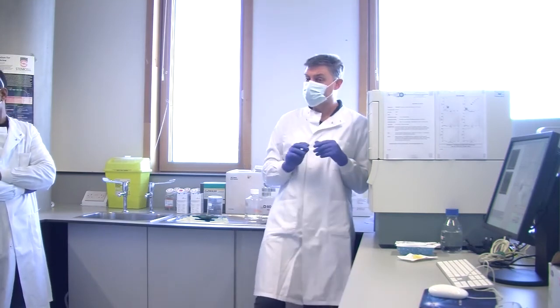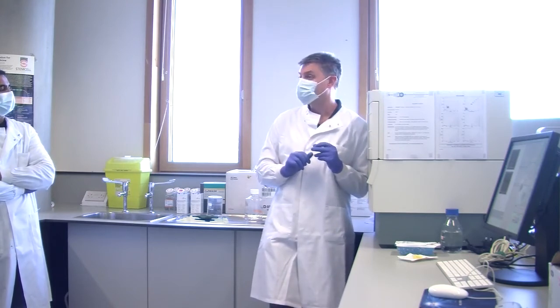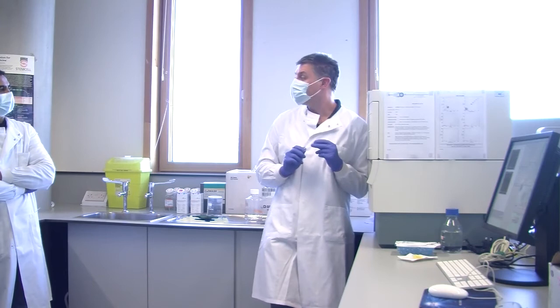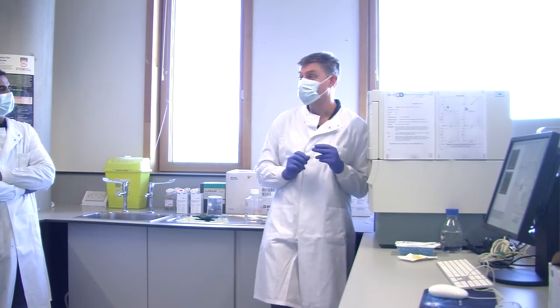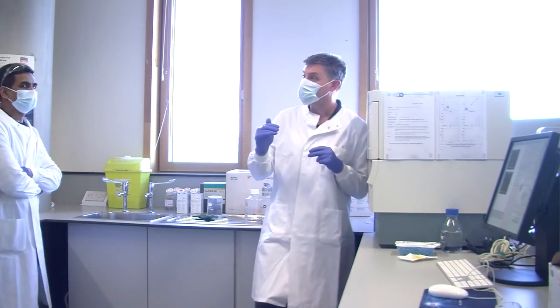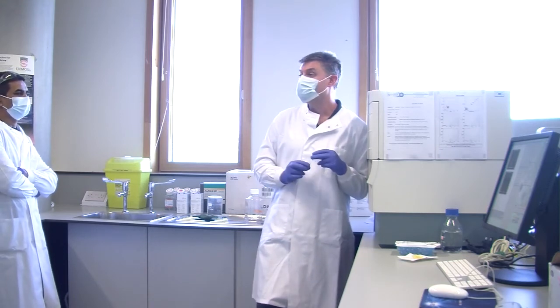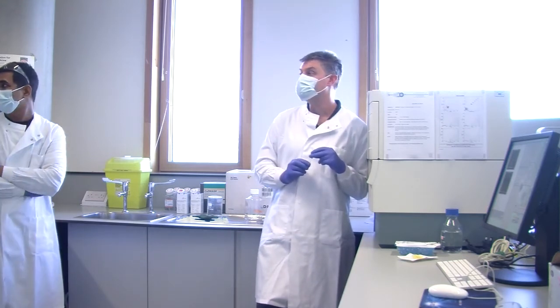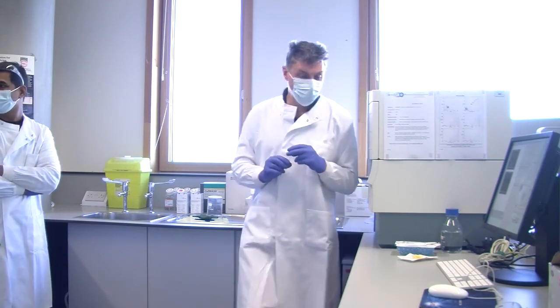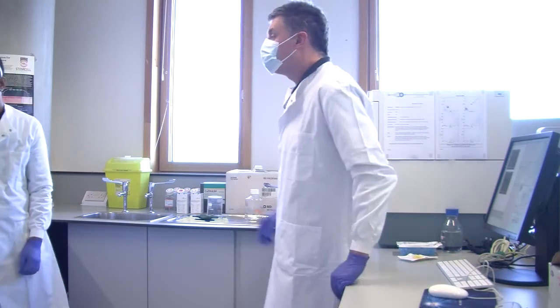But I would certainly say, and this is not just cytometry, always, always, always ask why you're doing a particular step. Because if the person running the experiment can't explain to you why you're doing it, do you really need to do it? That's what I would be asking. For each of the steps in your protocol, I can tell you exactly why we're doing it and what would happen if we didn't. So, are we about done with the first incubation? Right, okay, so if you want to carry on with your labelling process, and then we'll look at data in the second incubation.